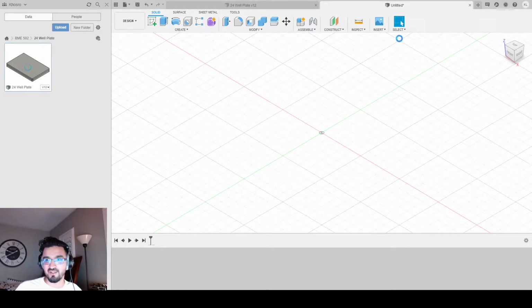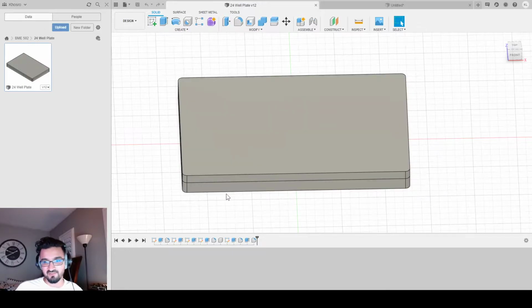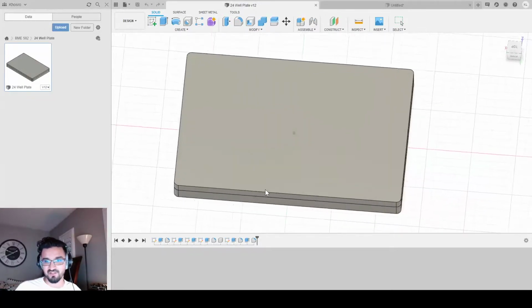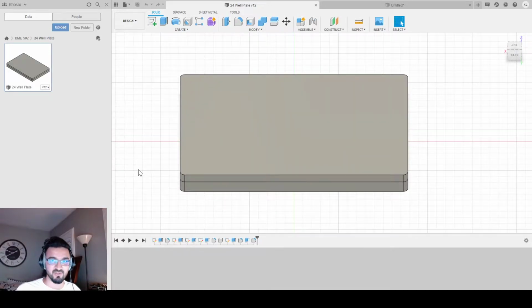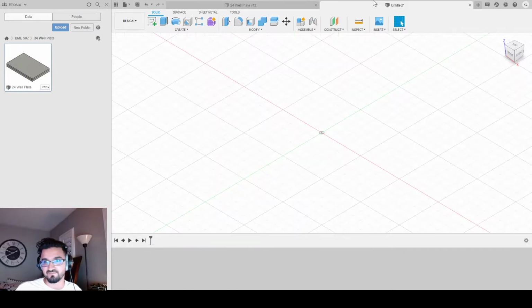Here I'm going to be doing another 24 well plate tutorial. So eventually we're going to get this nice smooth plate here with a lid as the goal. But unlike the other tutorial, I'm going to do what I usually do. So hopefully you've learned a trick or two on how to make a plate. If not, please watch my first video. Without further ado, let's get started.